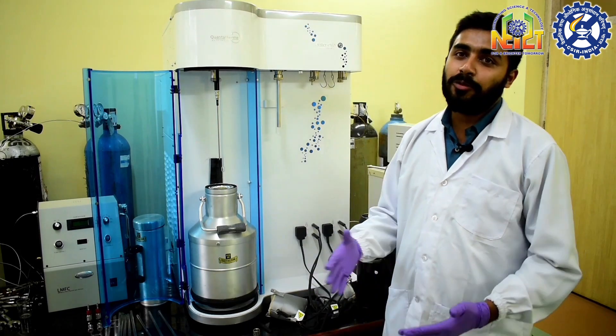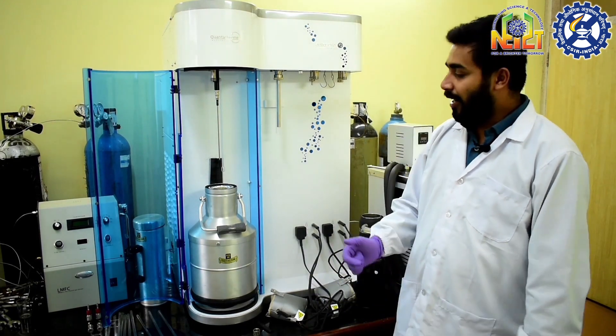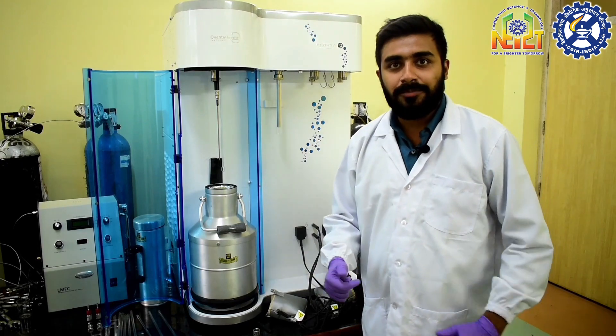The adsorption of nitrogen gas is only done at liquid nitrogen temperature and we should be very careful while dealing with liquid nitrogen.